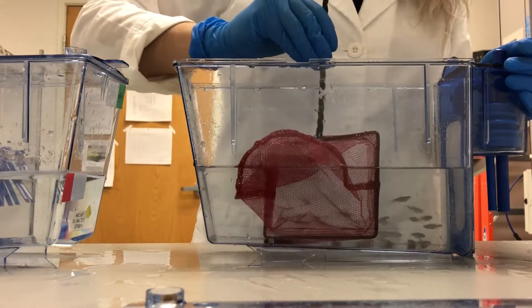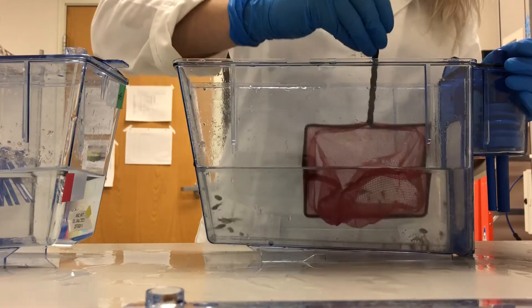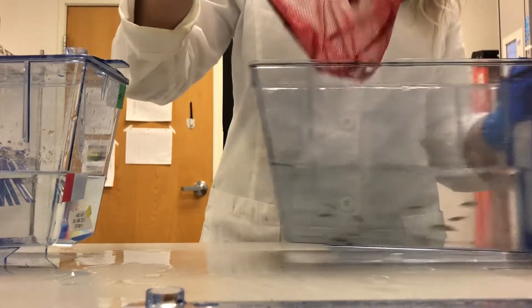When handling the fish it's important to move slowly and carefully as to not scare or injure any of the fish.